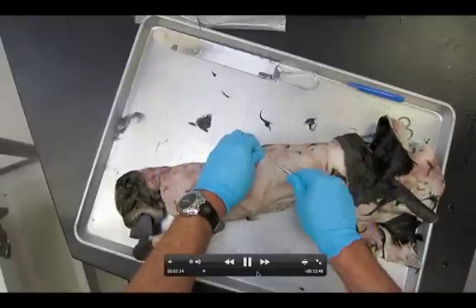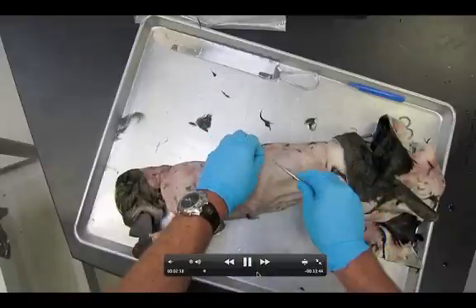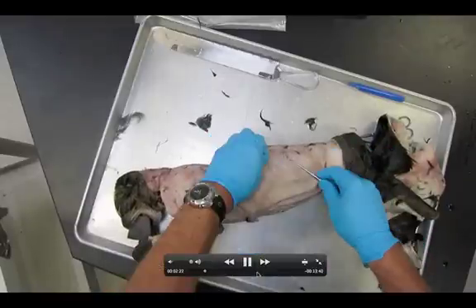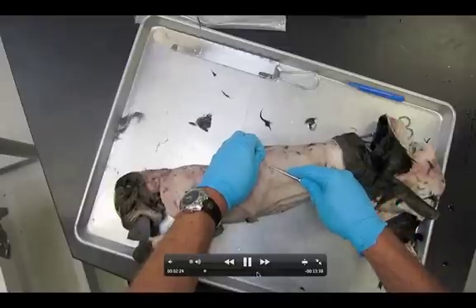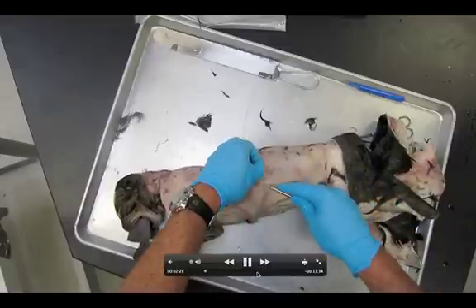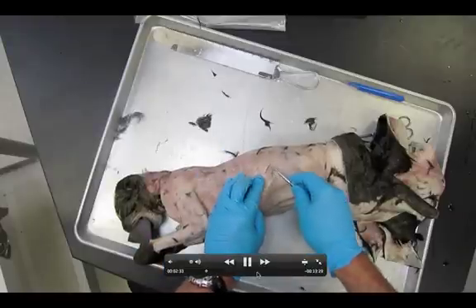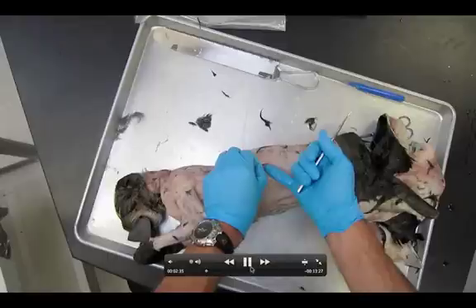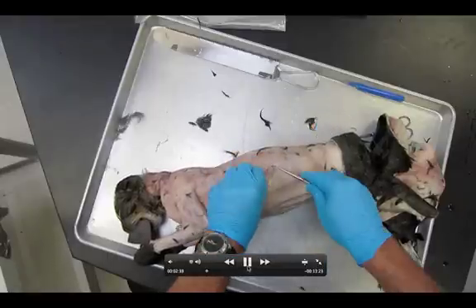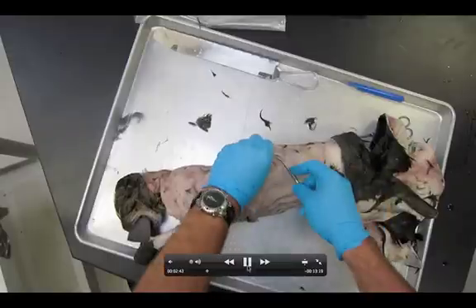There's this white fascia, this loose connective tissue that's going to be all over everything. You can see me actually pulling away at it with my probe, getting underneath it. Right now my probe is about to get underneath this muscle, which is the latissimus dorsi. You can see how my probe is actually under the muscle, and now my finger is underneath it. I'm going to keep extending this margin all the way back.